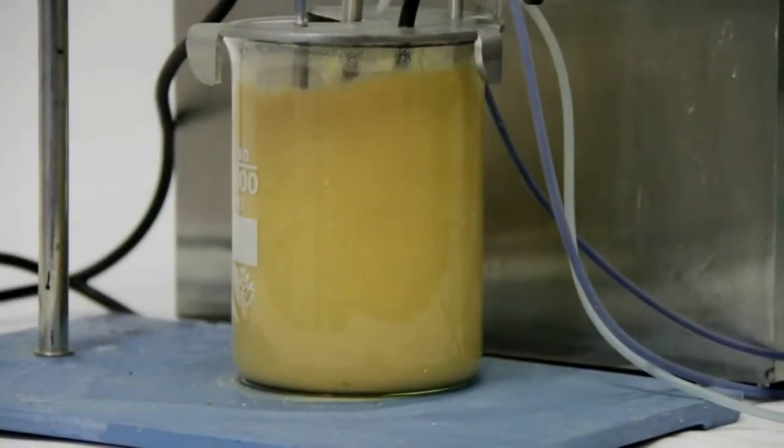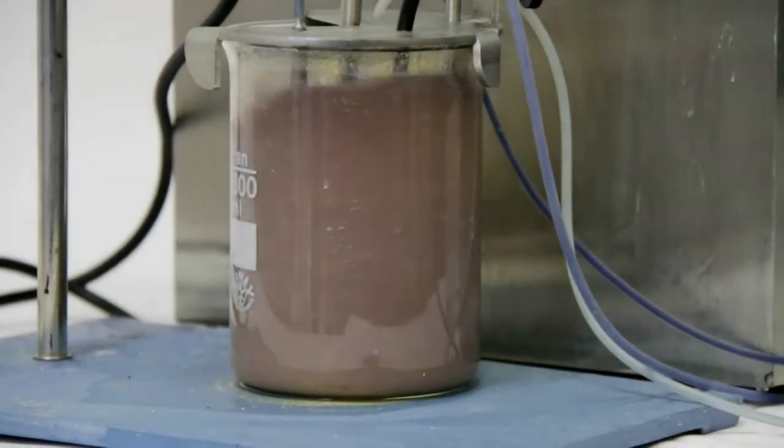After you insert the filter, the probe is installed in the beaker in order to initiate the test.